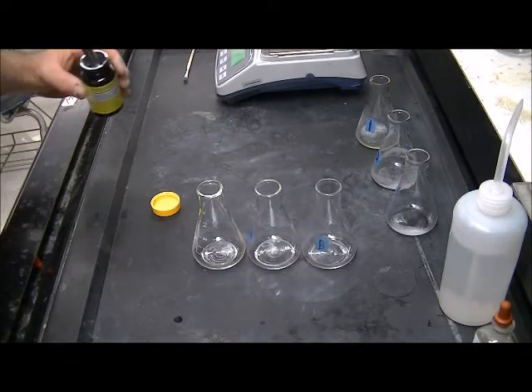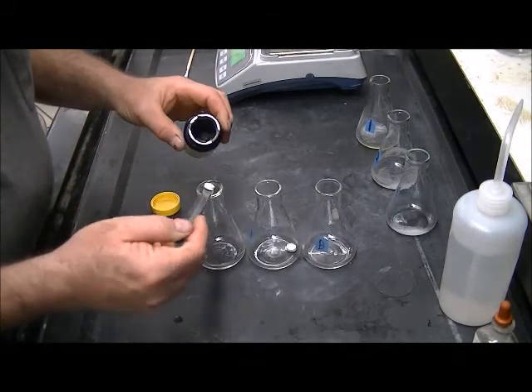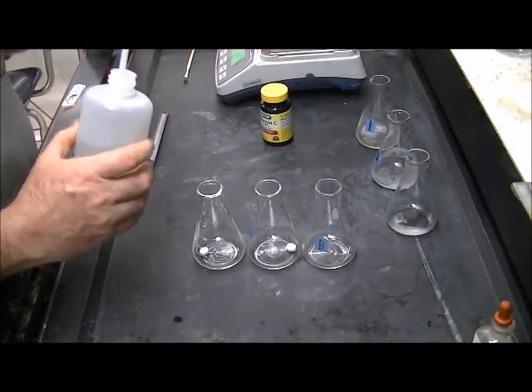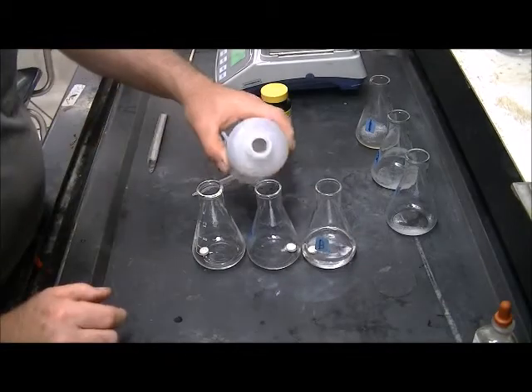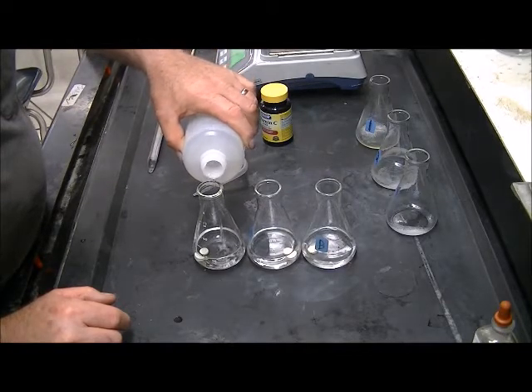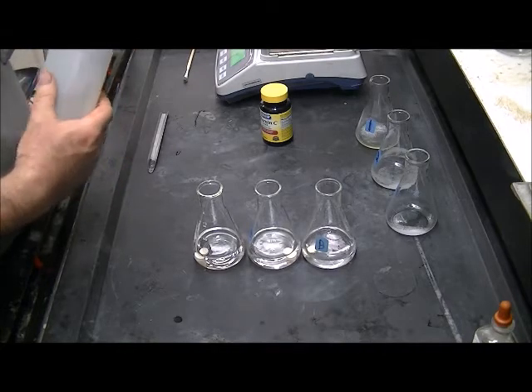The next step is to start dissolving our vitamin C tablets so that they are ready when we get to them. It will take a few minutes to dissolve. I'll put a tablet in each flask and then add some distilled water to each one. We'll set those aside so they can dissolve while we're doing the other part of this titration.